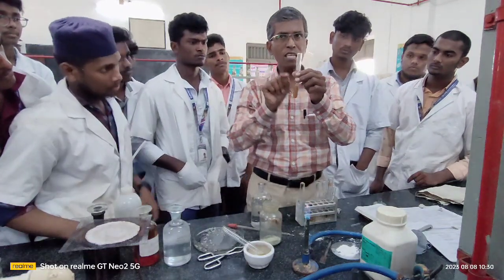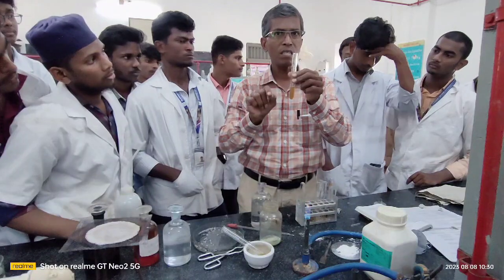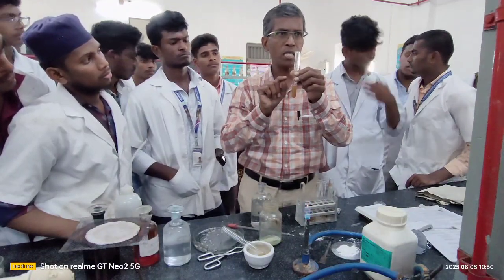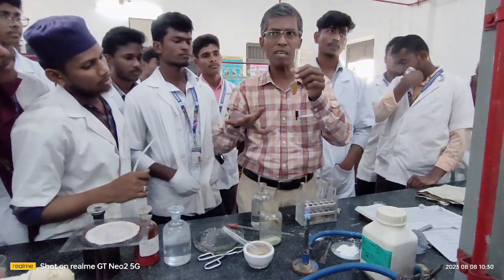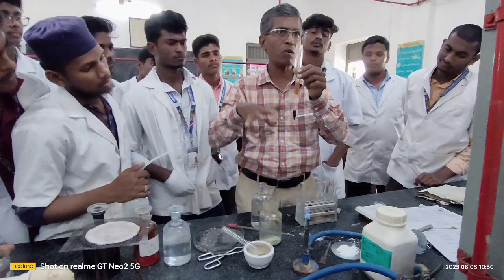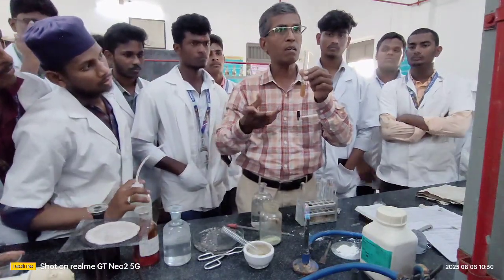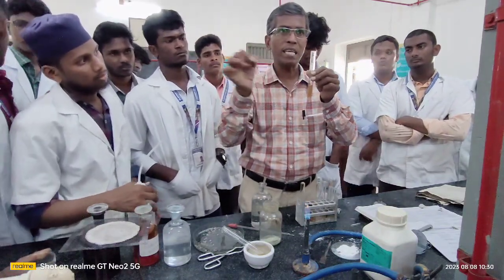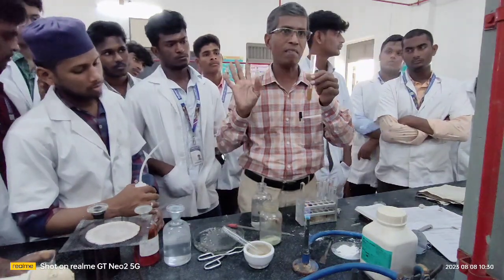The same procedure you follow. If you have nitrogen, please be careful. The procedure is very simple. You prepare carefully the sodium fusion extract. I told you how to prepare it, how to handle all those glasswares and how to handle the sodium metal, why we keep the sodium metal in kerosene, why not in water, what will happen when we bring that sodium close to water, in contact with water. Everything I have explained.